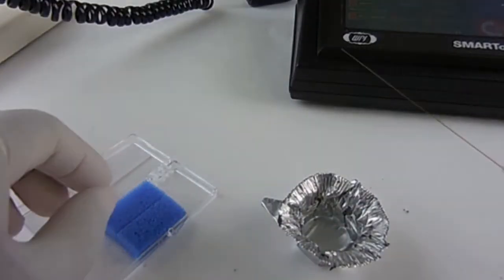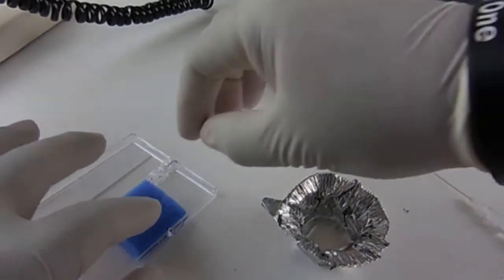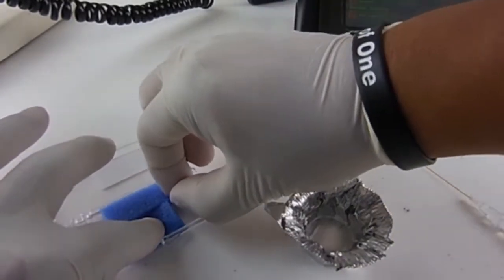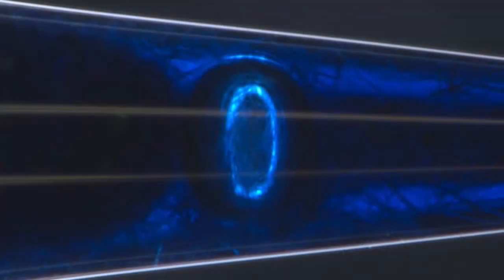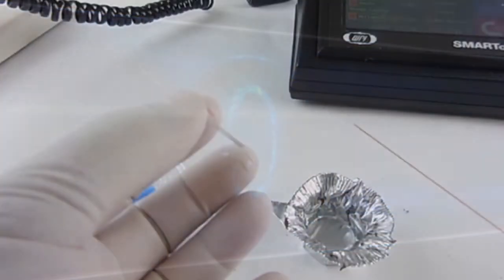Once you have the micropipette, you need to fill it with mineral oil. You need to fill the micropipette completely with oil using the microfill needle. Try to avoid any air bubbles inside the micropipette. This is easier said than done. This process is called backfilling.